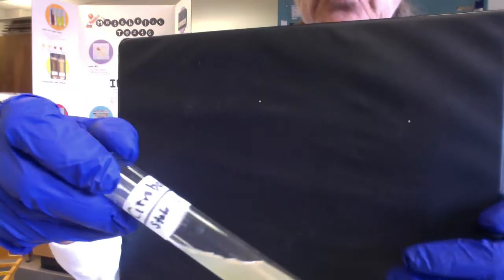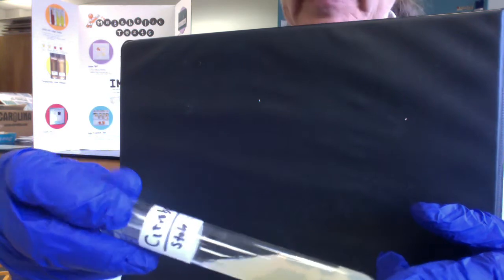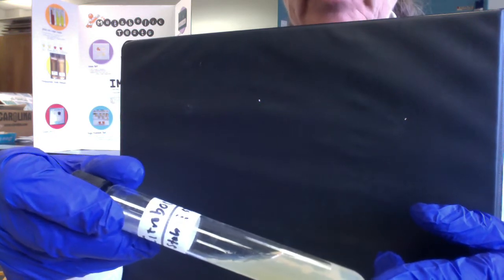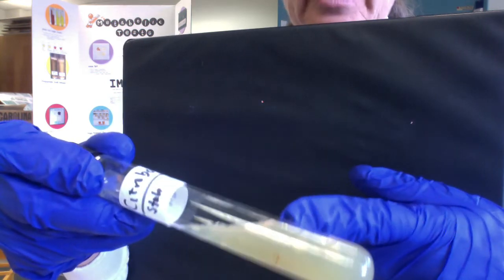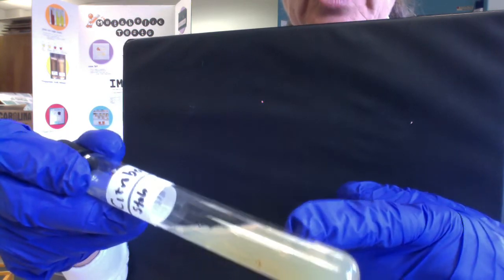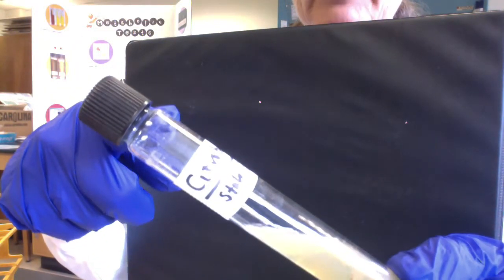So we'll see later, folks, this is one reason when we incubate our tubes in those cans, remember we're going to loosen the caps, but we always want to put a paper towel in the can and spray it with disinfectant, because we'll see later sometimes there's so much gas produced in these big butt slants that the slant will be blown apart and it will blow the agar up.